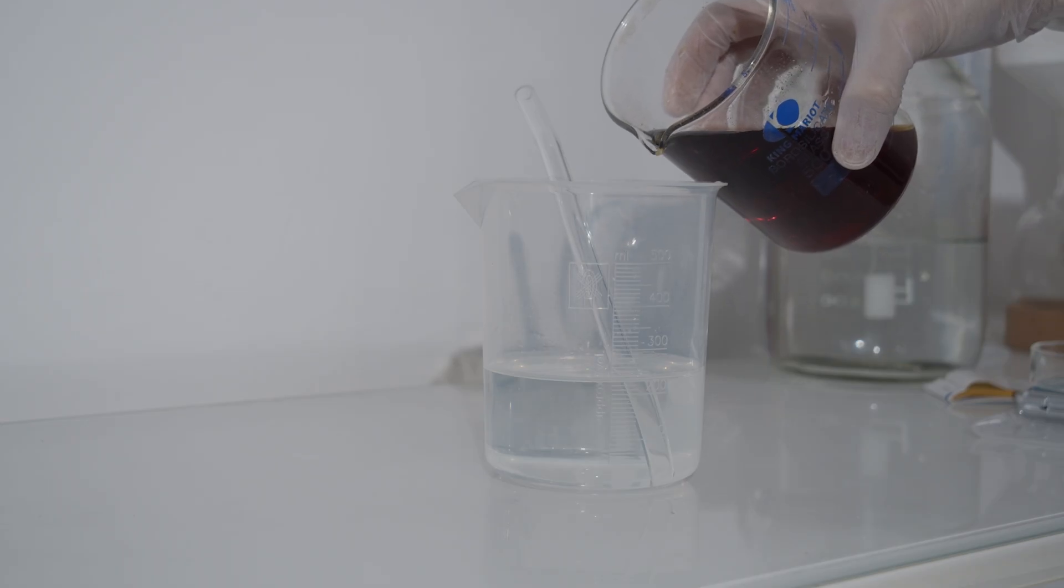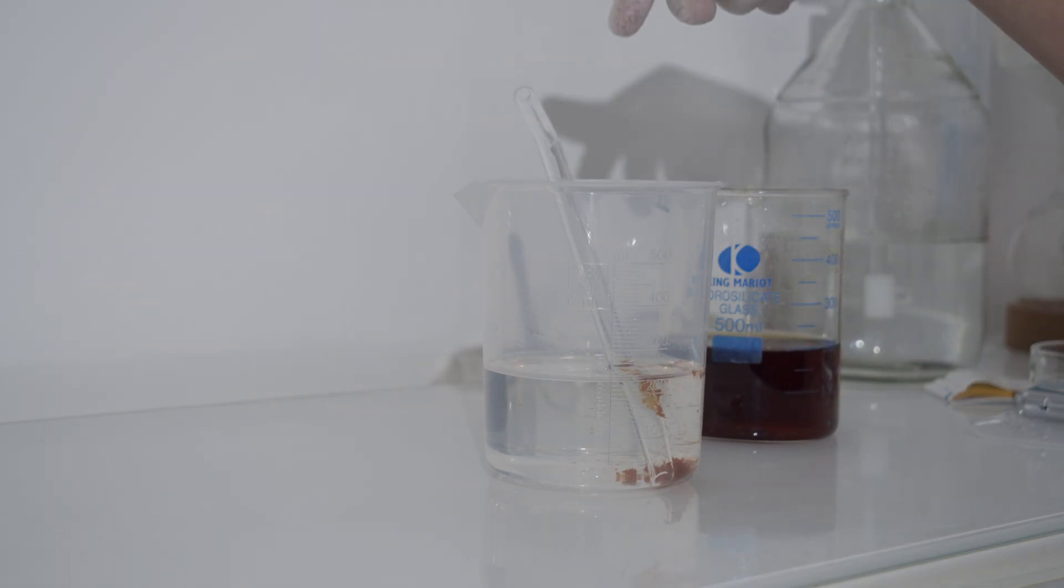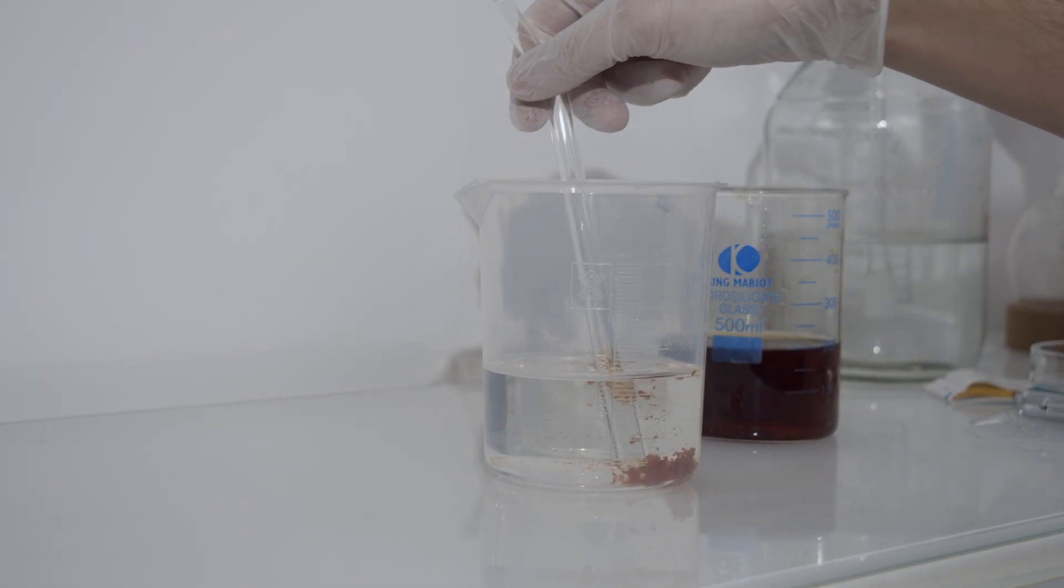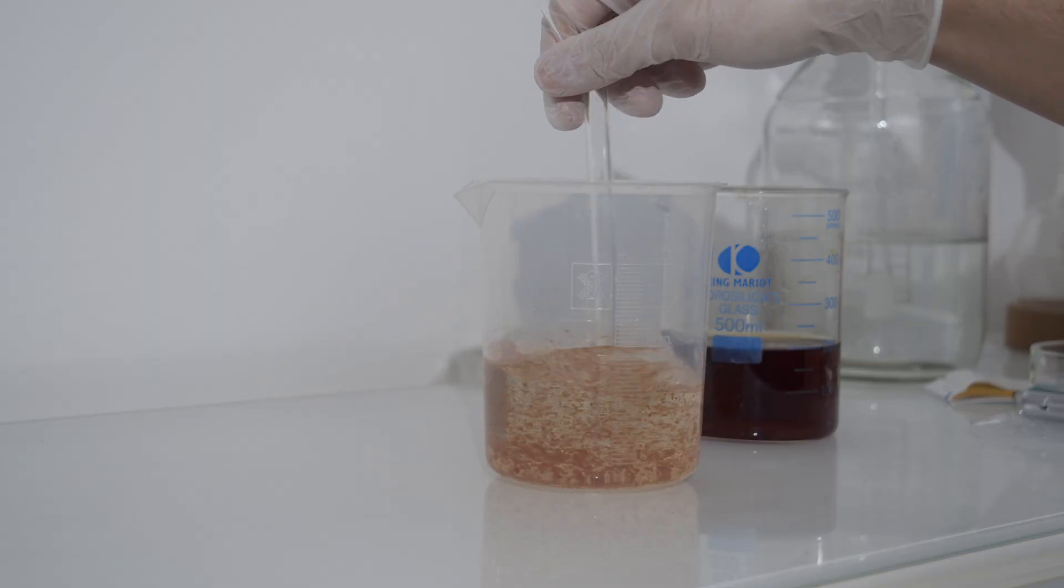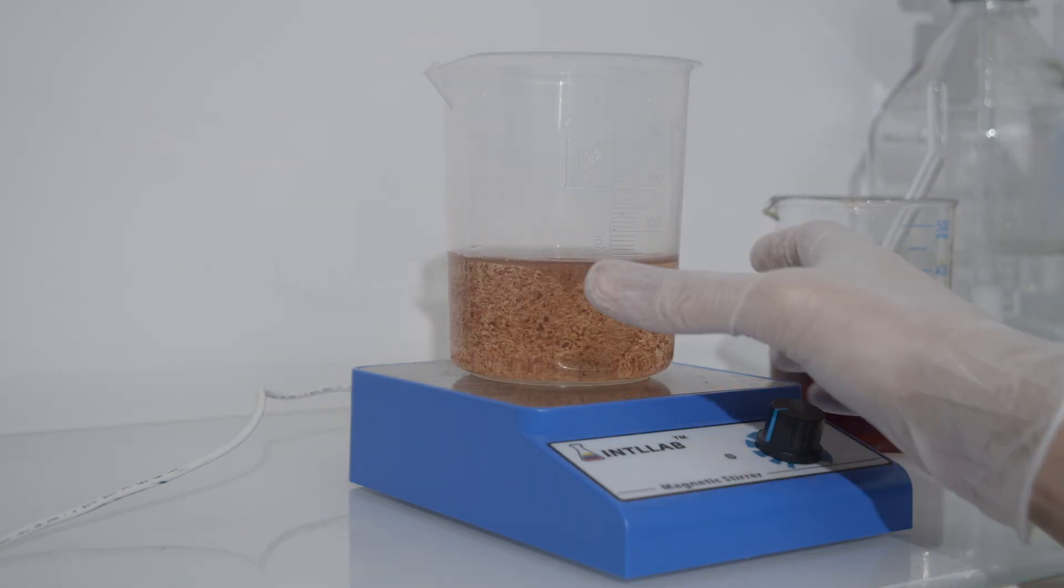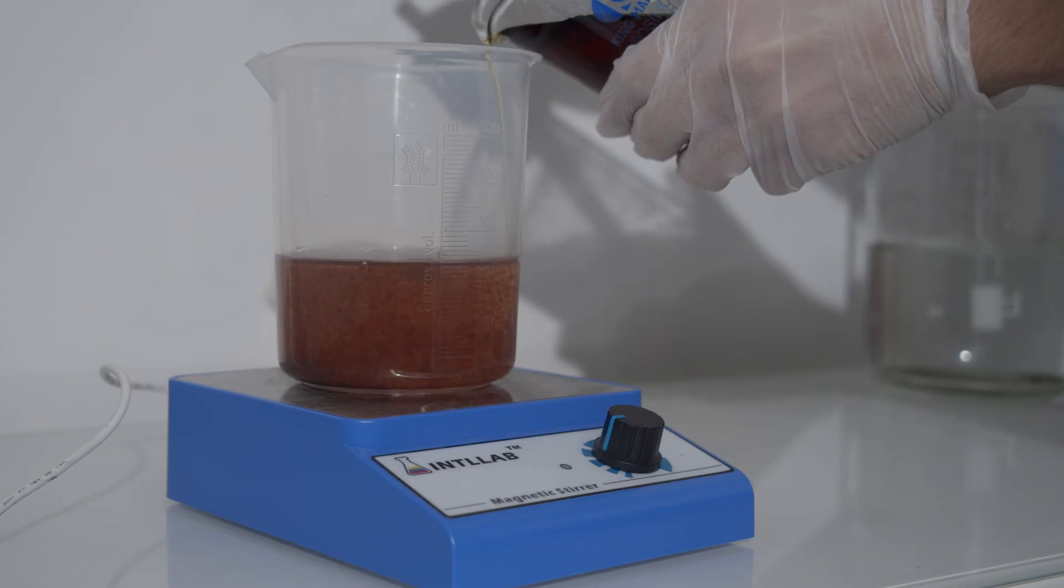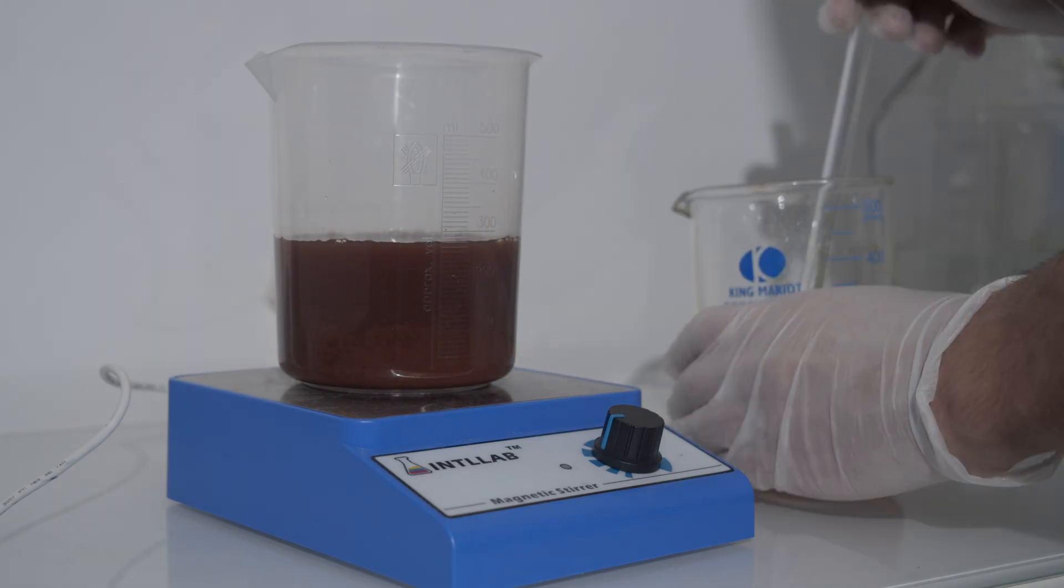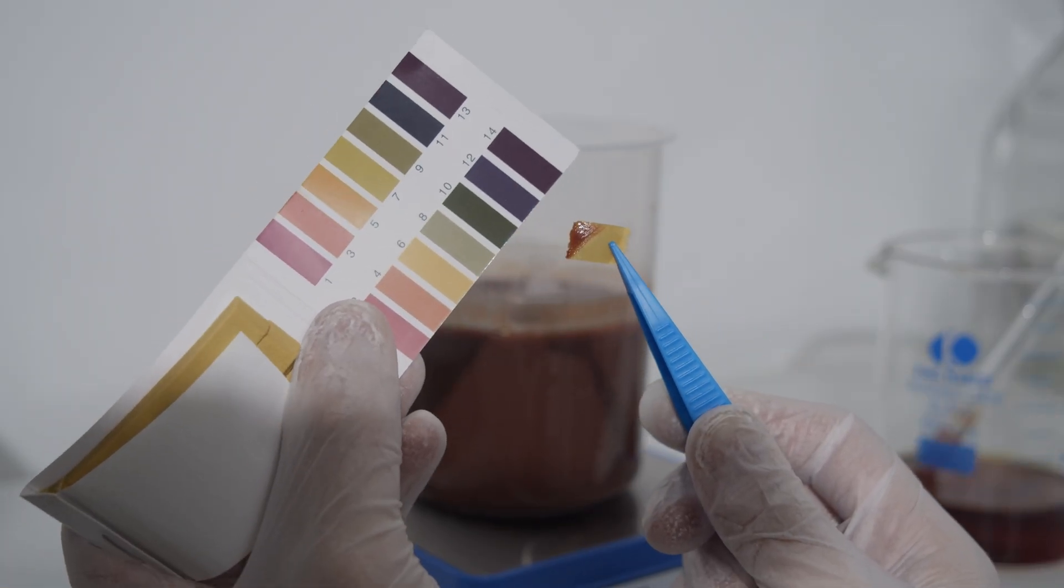I started by adding a small amount of the iron 3 sulfate to the potassium hydroxide solution. A brown solid of iron 3 hydroxide formed immediately, turning the solution murky. But the precipitate was extremely thick, so to make sure everything reacted properly, I switched on the magnetic stirrer. I stopped the addition once the solution hit around pH 7, right where iron 3 hydroxide fully precipitates.